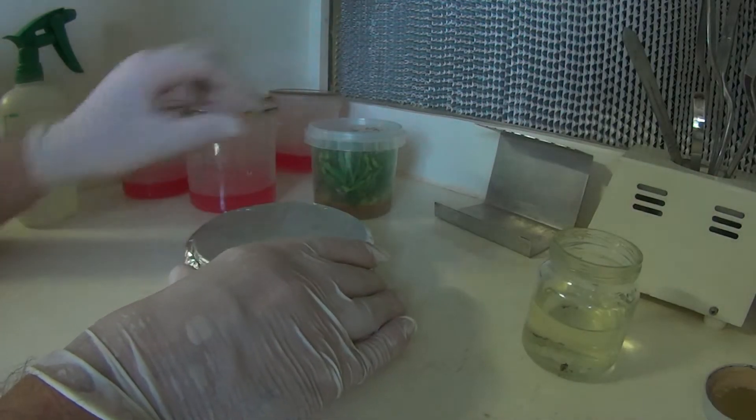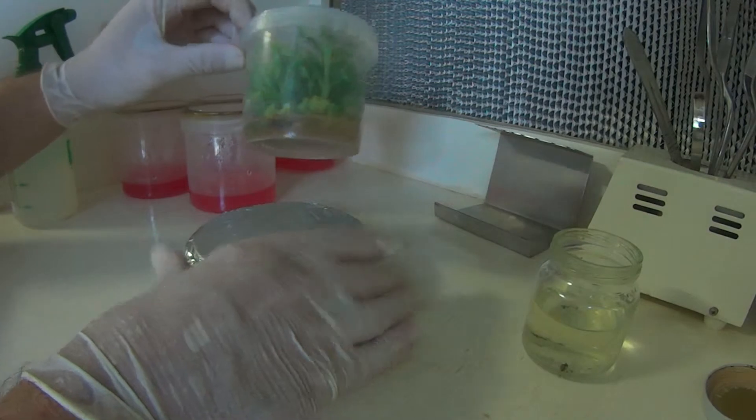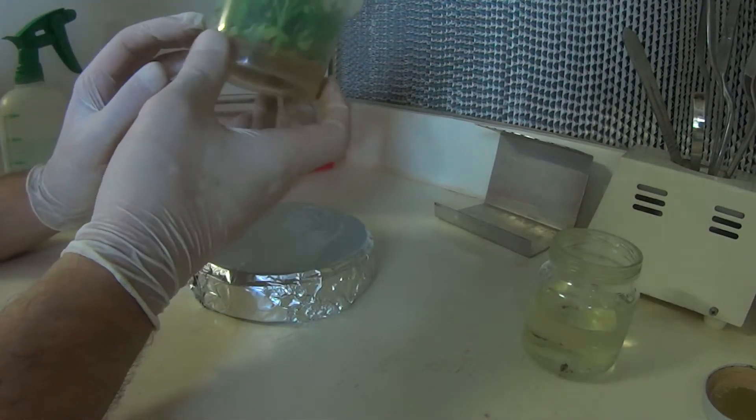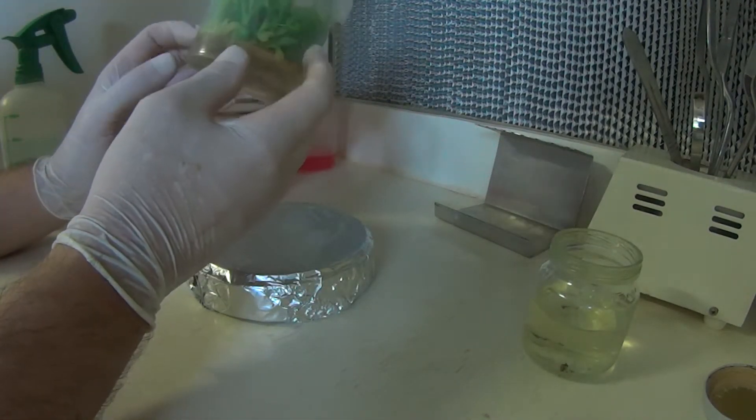Welcome back, I'm just going to divide up this container of plants here. Well technically it's one plant at the moment.